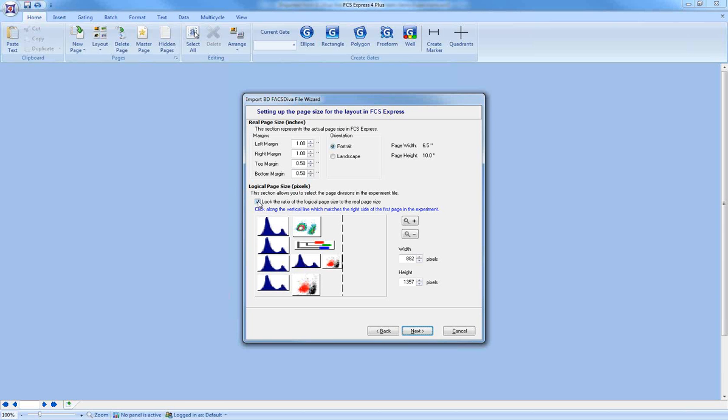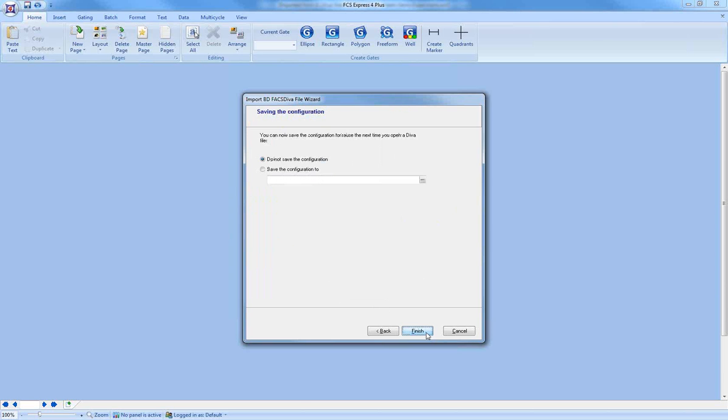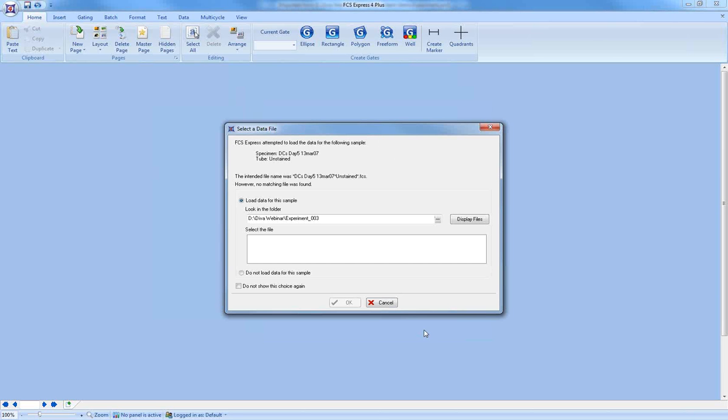and so on. I'm going to unlock the aspect ratio so that I can create something that matches what I want. Let's make this a little smaller. Okay, now everything's going to fit on the page. When I say next and finish, because FCS Express could not find the data files, it asked me where the data files are. So it's trying to find a data file that matches this specimen and the unstained tube.